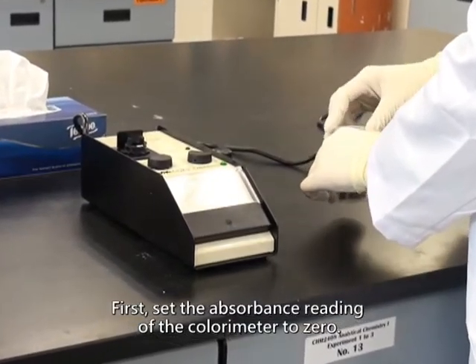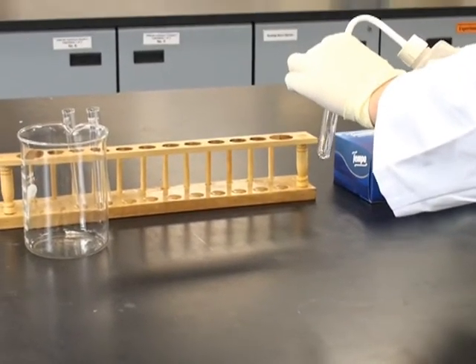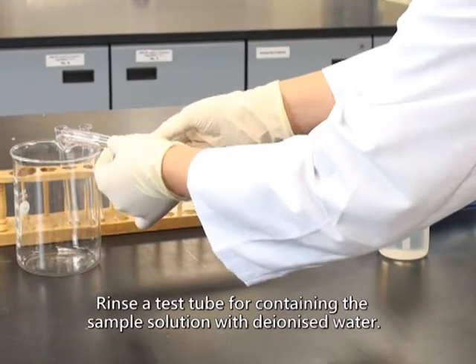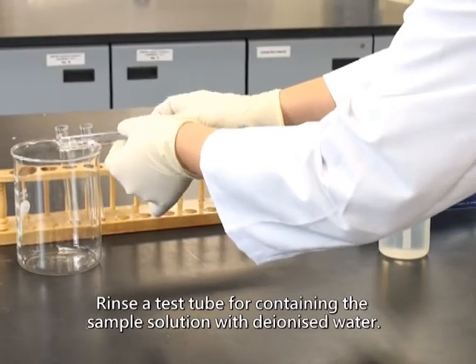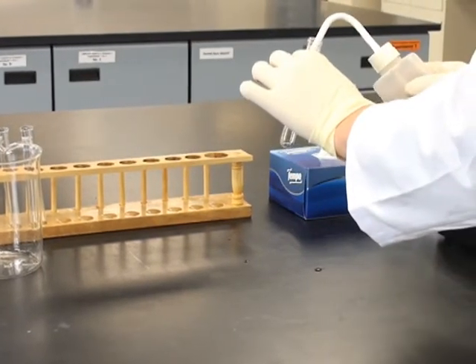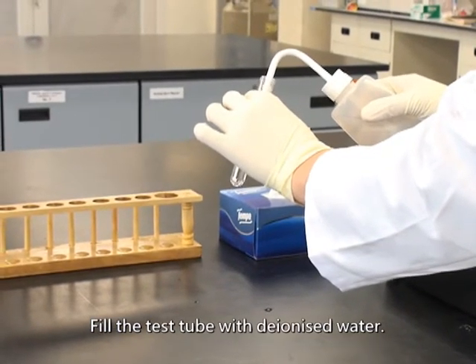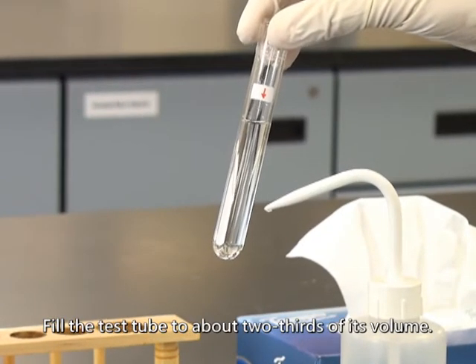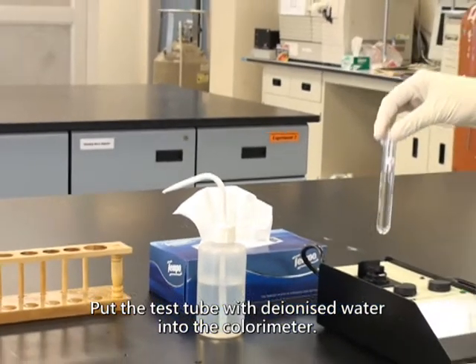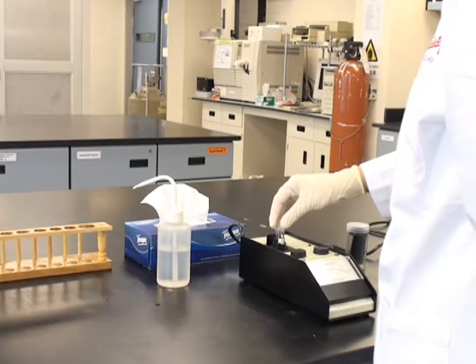First, set the absorbance reading of the colorimeter to 0. Rinse the test tube for containing the sample solution with deionized water. Fill the test tube with deionized water, to about 2/3 of its volume. Put the test tube with deionized water into the colorimeter.